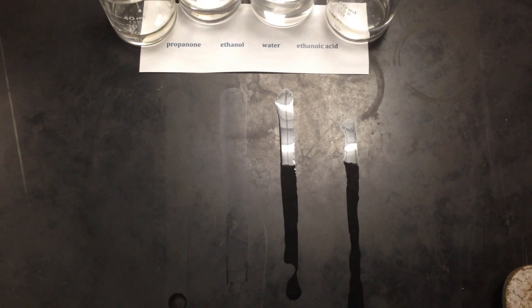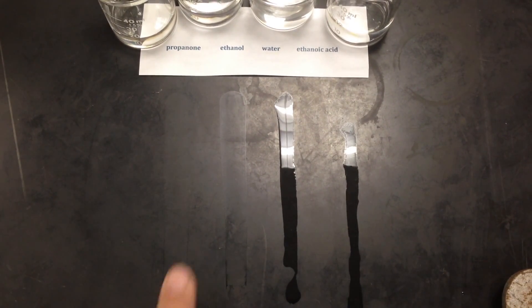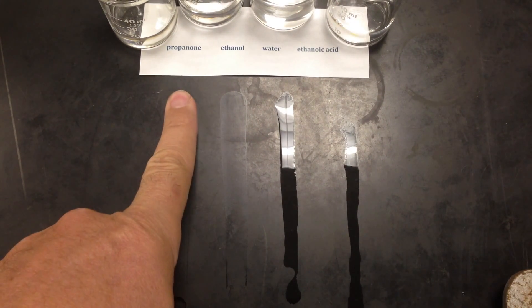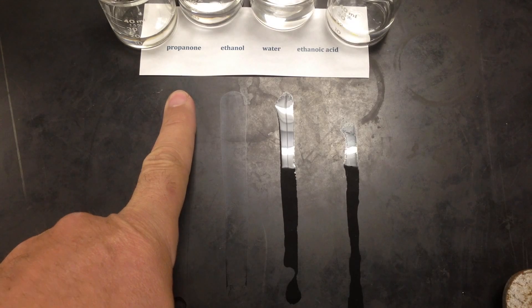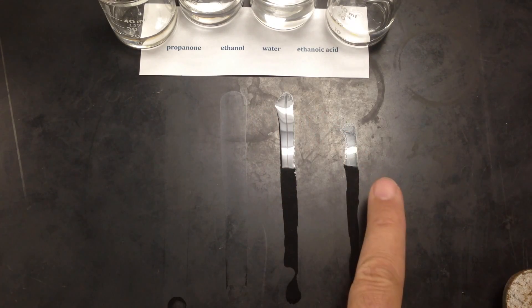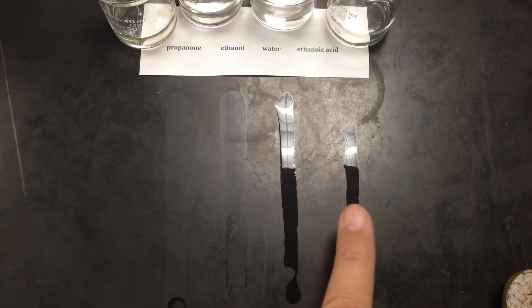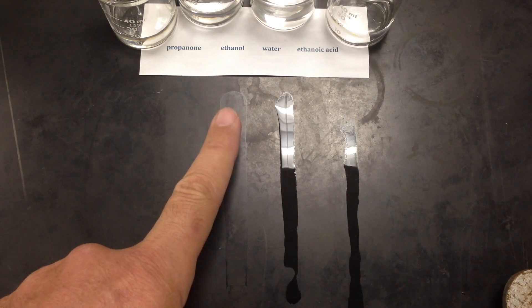So between these four liquids, you can say that this one had the highest vapor pressure, which means the highest rate of evaporation. This one's going to have the lowest, or it has the lowest, because it is beading up the most. It will last the longest.